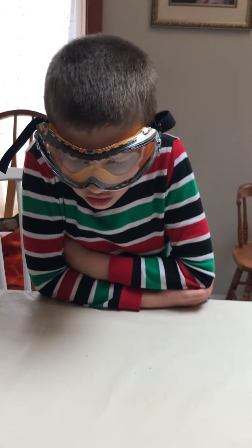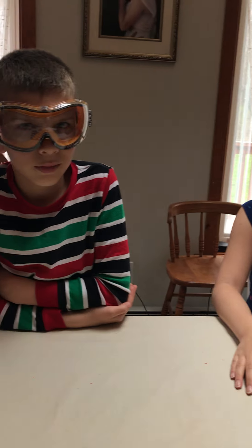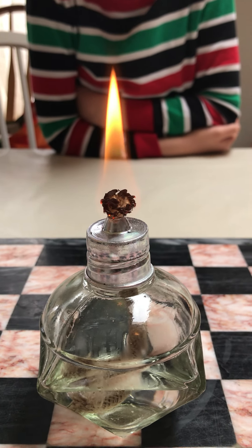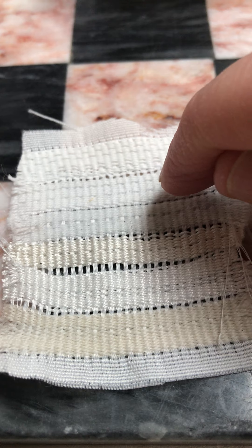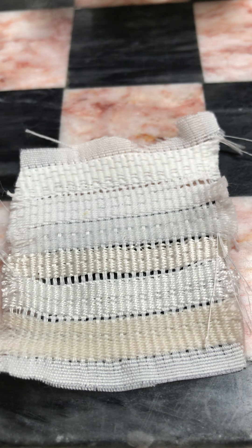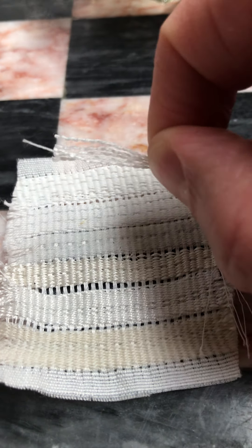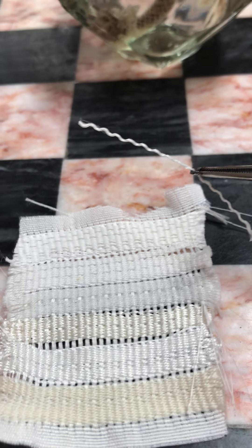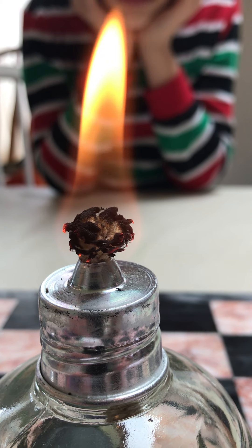Assisting me today are James, Bridget, and Liam - notice they are all wearing their safety goggles for this experiment. Our first fiber comes from our multi-fiber fabric, which contains acetate, cotton, nylon, silk, viscose, and wool - literally multiple types of fiber in the same fabric. These are our known fibers that we're going to compare our unknown fibers to. We're going to start with acetate - I've already teased a thread of acetate out of the fiber.